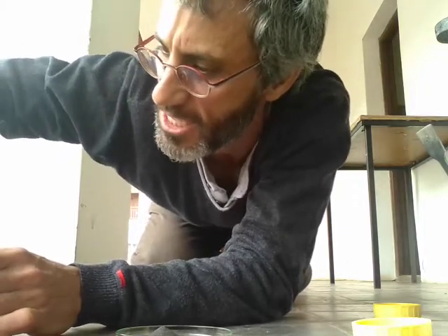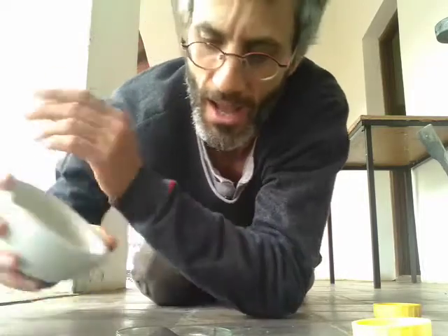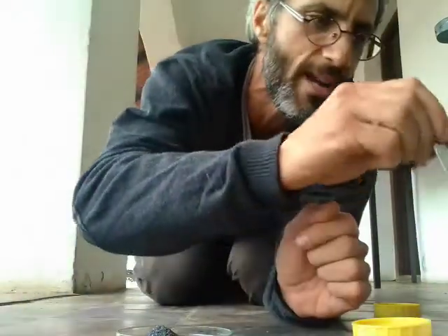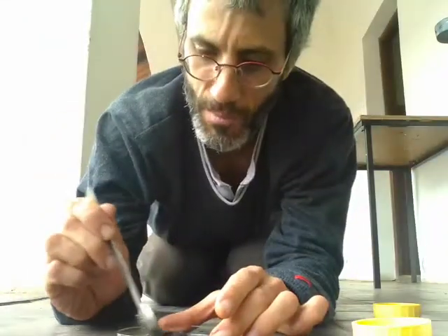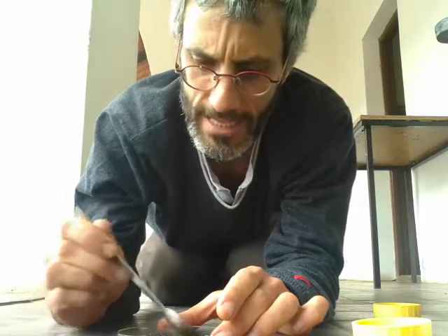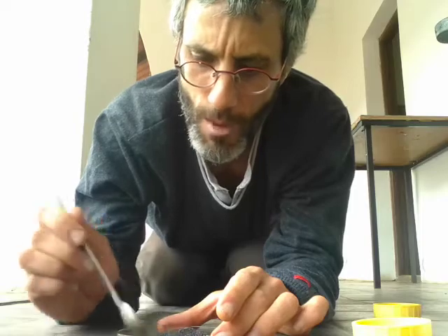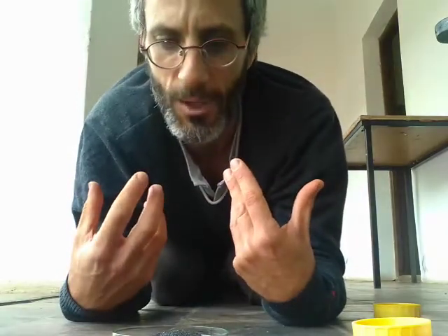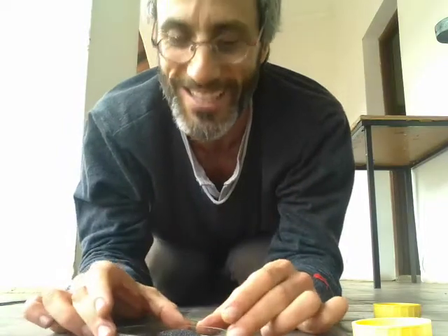So magnesium is an alkaline earth metal. It's not as reactive, okay? And halogens are quite reactive, okay? But as I said, right now, nothing much is happening. So I'm mixing it a little bit. Next year, we're going to learn a little bit more about chemical reactions, but I can already tell you one little secret. Sometimes you need to stimulate the chemical reaction. You need to kind of convince the element to go on, react, okay?